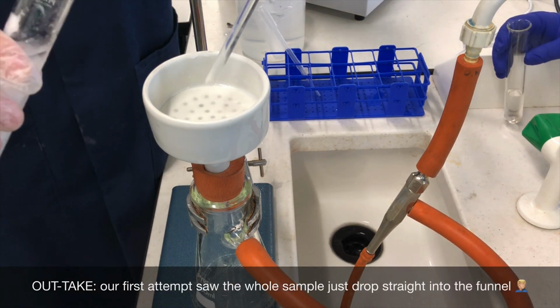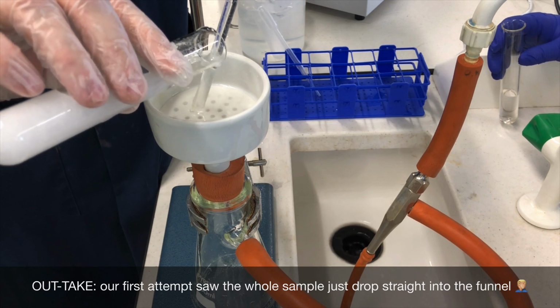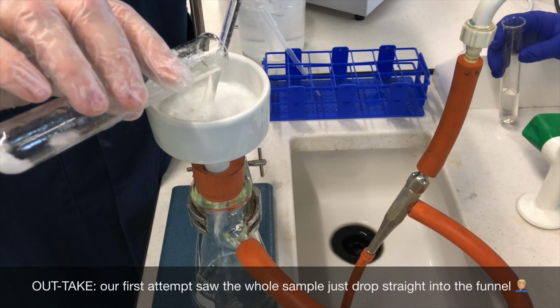A little outtake here to prove that even we get it wrong sometimes. As you'll see now, trying to filter under reduced pressure, all of the sample just drops straight there into the Buchner funnel. Devastating.